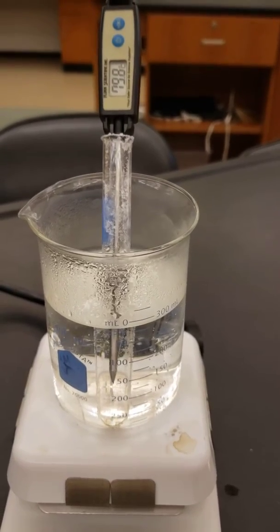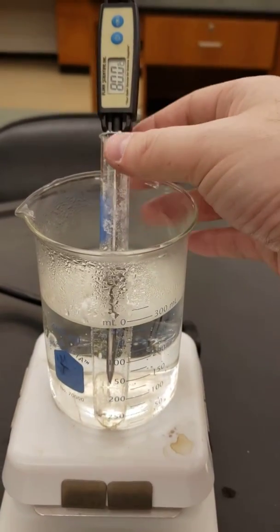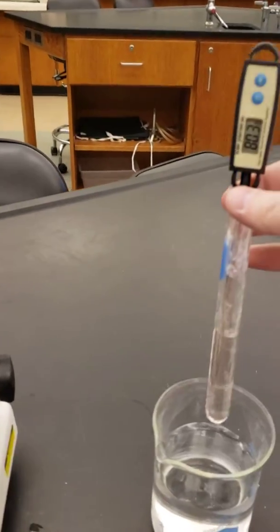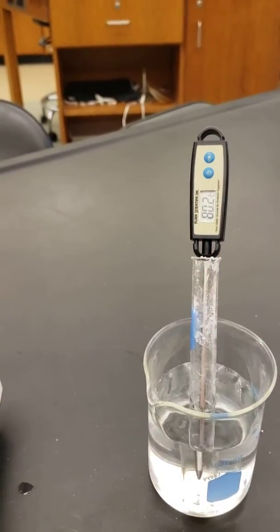I'm all melted now and I'm at 79, 80 degrees here. So I'm going to take this out and put it in the water bath at 80.2.